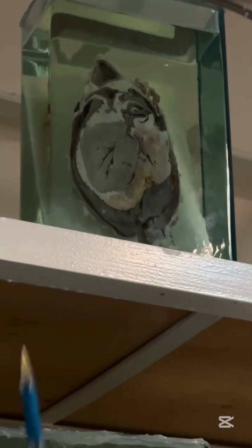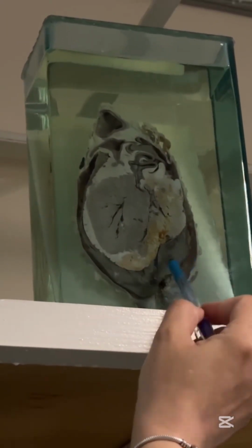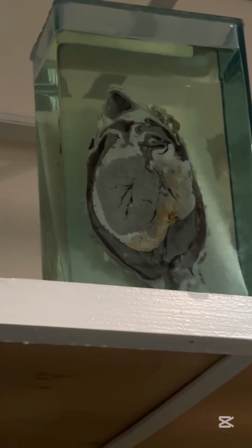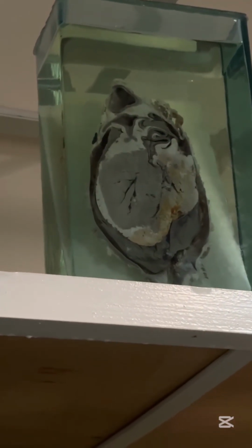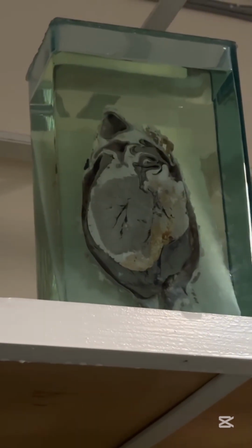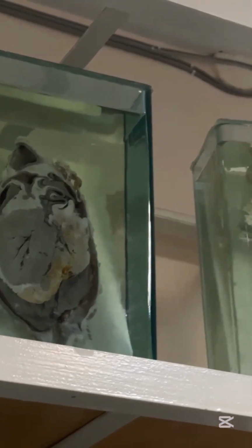After that, rupture of left ventricle and internal bleeding. Blood comes through this hole to the cavity of pericardium. And this blood compresses heart. That's why it is sudden death, and we call it tamponade. You should remember about transmural infarction and rupture. That one.